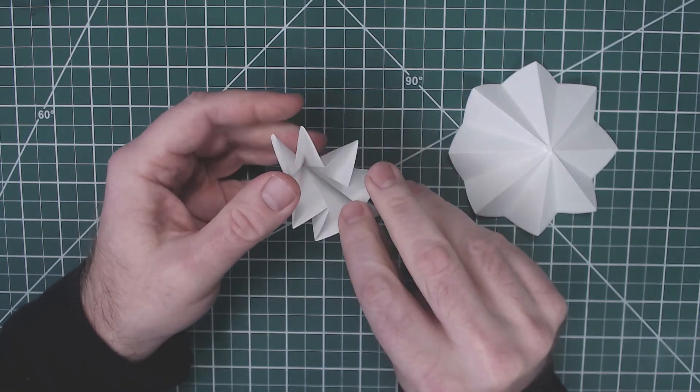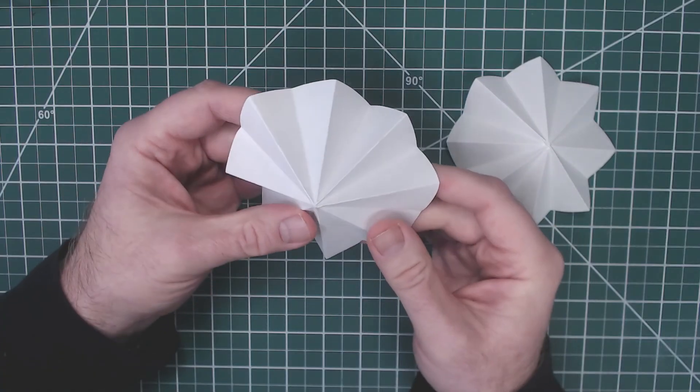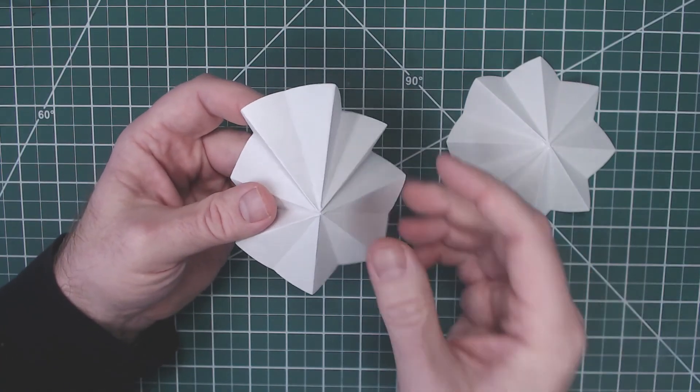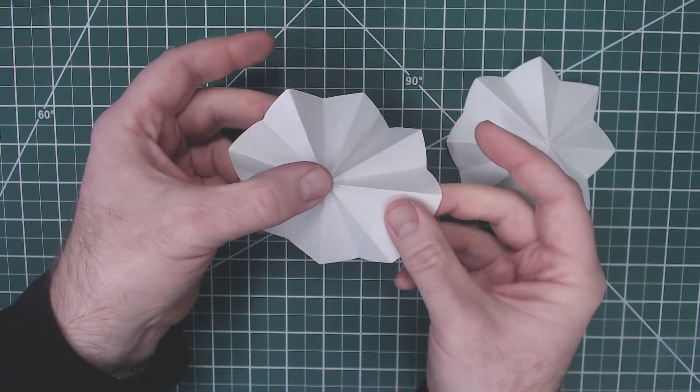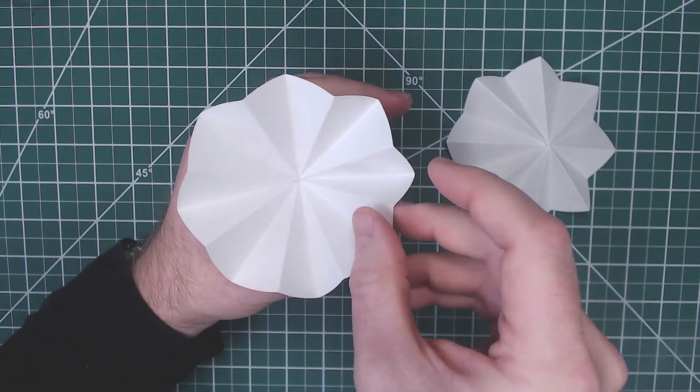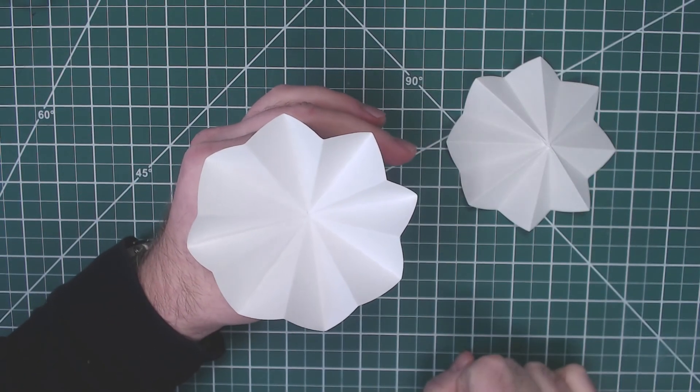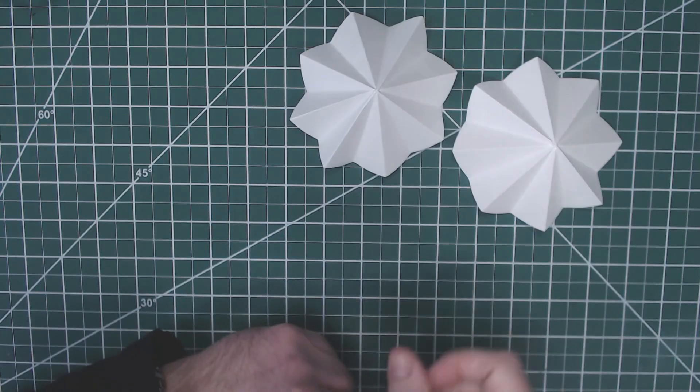We have finished folding it, and to get it so that it sits perfectly inside the filter, I recommend taking it, inverting it, and putting it into your funnel. And that is how you fold fluted filter paper.